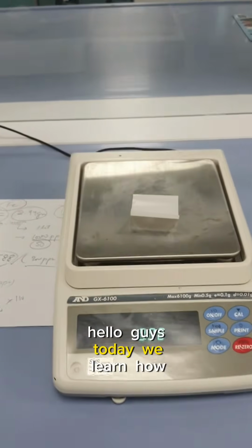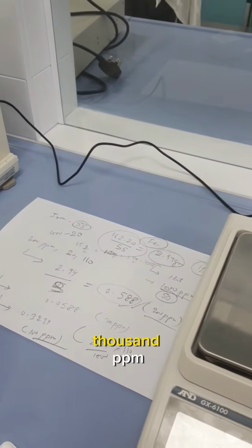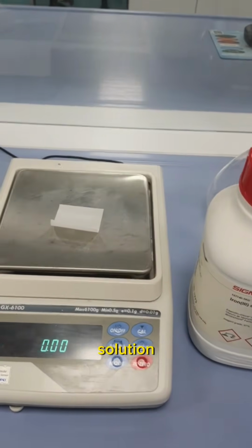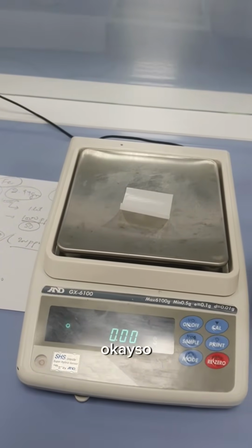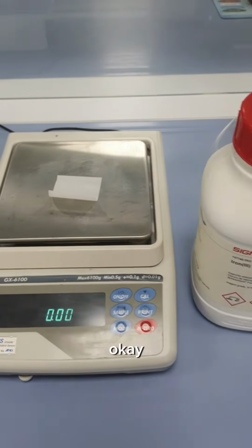Hello guys, today we'll learn how to prepare 1000 ppm, 100 ppm, 200 ppm or 500 ppm of iron from the iron chloride solution. So in our last videos we learned in detail about the concept of normality and molarity. In today's video we learn how to prepare ppm solution.